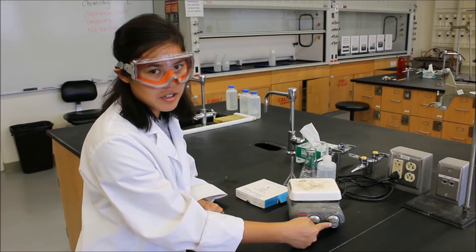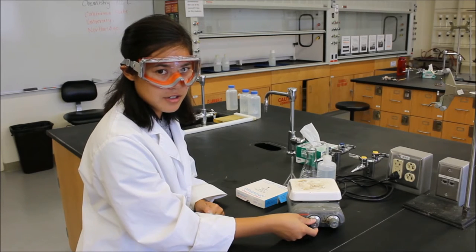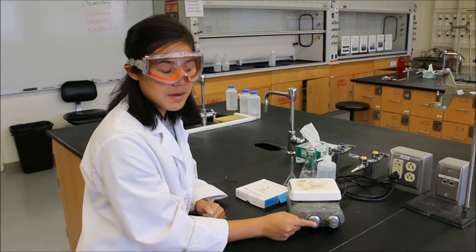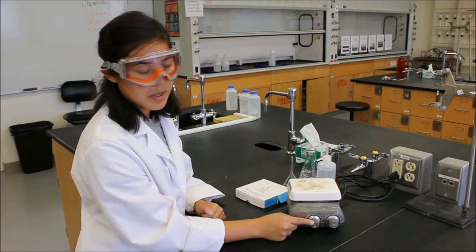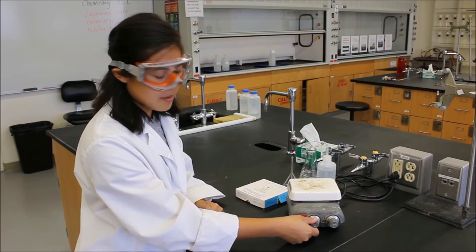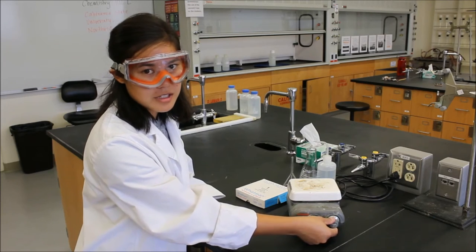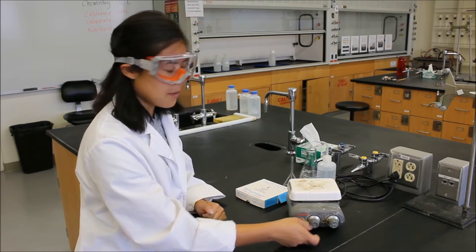This will heat your solutions. This will stir your solutions. The reason we want to stir our solutions is so that when they're heating they won't bump, and you can always use the stirring option without the heating option. So if you ever need anything mixed you can always do this as well.